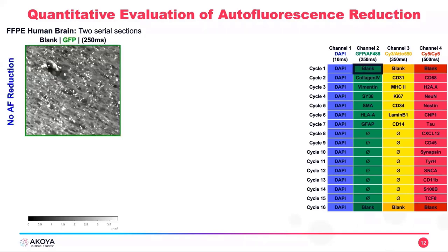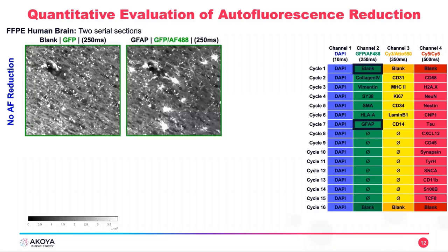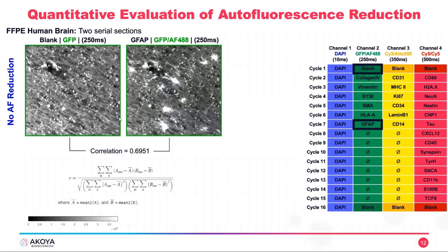So first I'm going to show a blank image acquired in the GFP channel without autofluorescence reduction. And as you can see here, we have very high intensities of background. Keep in mind, we are not looking at any antibody here or any reporter, we are just imaging autofluorescence. And then in the same channel, using the same exposure time, but with GFAP antibody, we can see additional information in the image, like all these astrocytes that we are seeing here, but we can see that there is very high correlation with the blank image, which is the background of the GFAP image. And here we have a correlation of almost 70%, which is considered very high. And you can see on this image to the right, all those speckles, very bright.